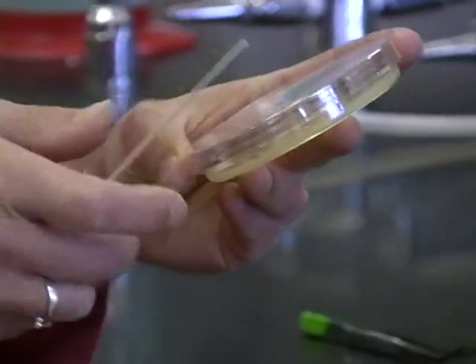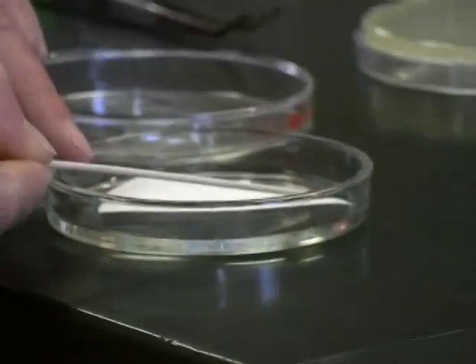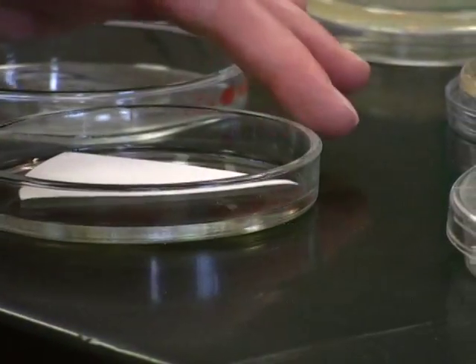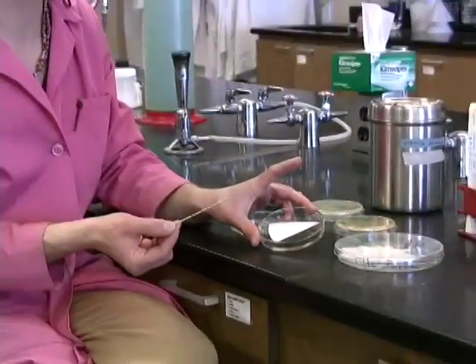So take enough of your Pseudomonas off of your plate that you can see it on your wood stick, and then you should be able to rub it onto your Whatman filter paper such that you can see it on the filter paper as well. If you can't see it, then you don't have enough. You're not going to be able to interpret something that you can't see. That's why this test is so different than any other that we do, because you're actually reading the results right here, right now, and you're not inoculating something and waiting for it to grow.